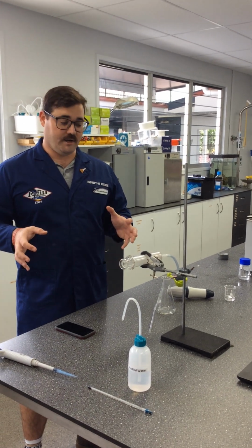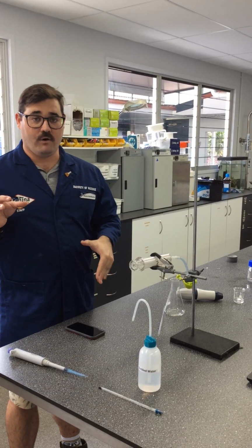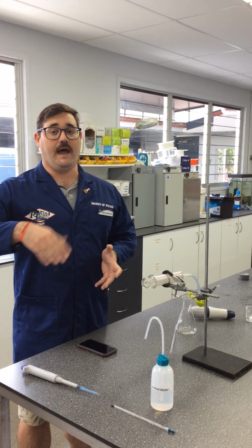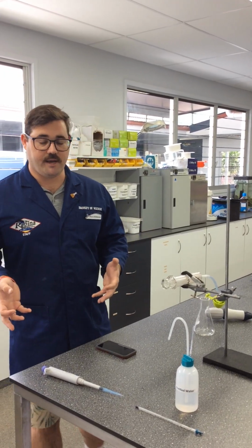Okay guys, so what I'm going to go through today is your mandatory prac. Now, in normal circumstances, you'll be doing this practical in class, you'll be conducting it yourself, and then your assessment would be to modify it. But obviously things are a little bit different at the moment with COVID and everything going on.